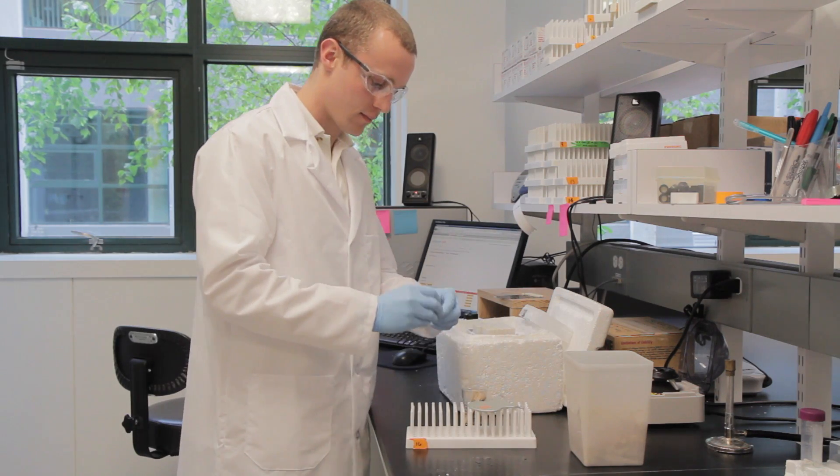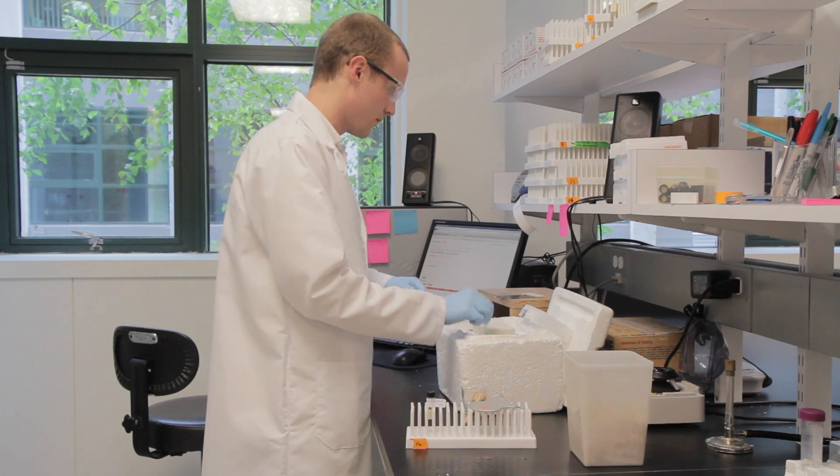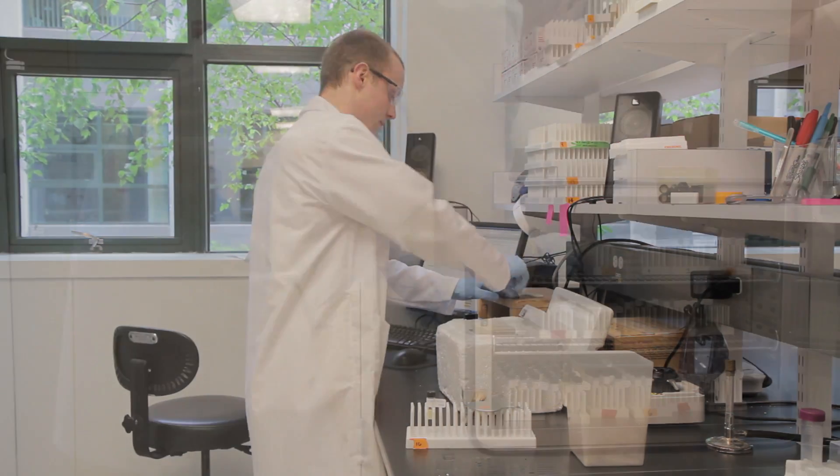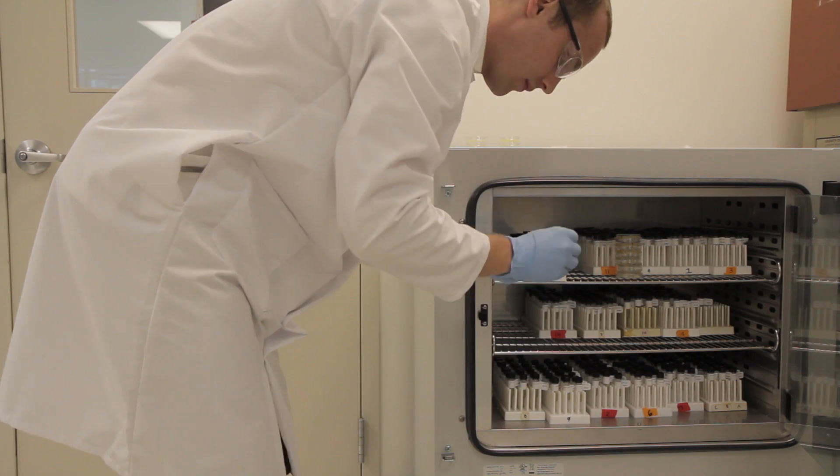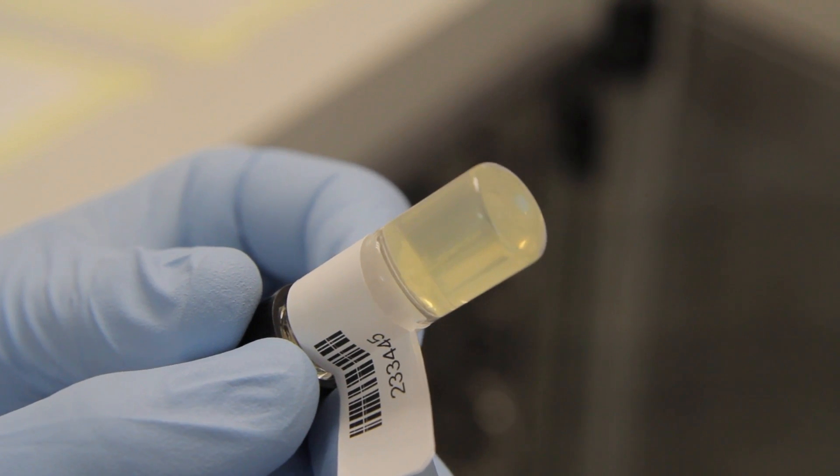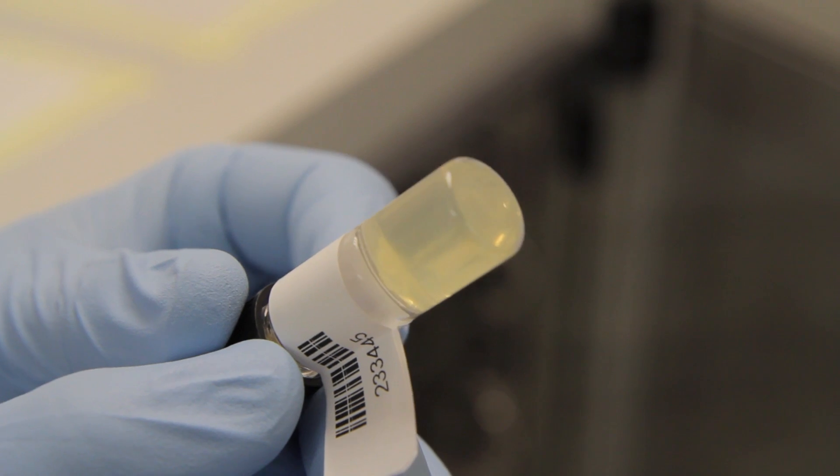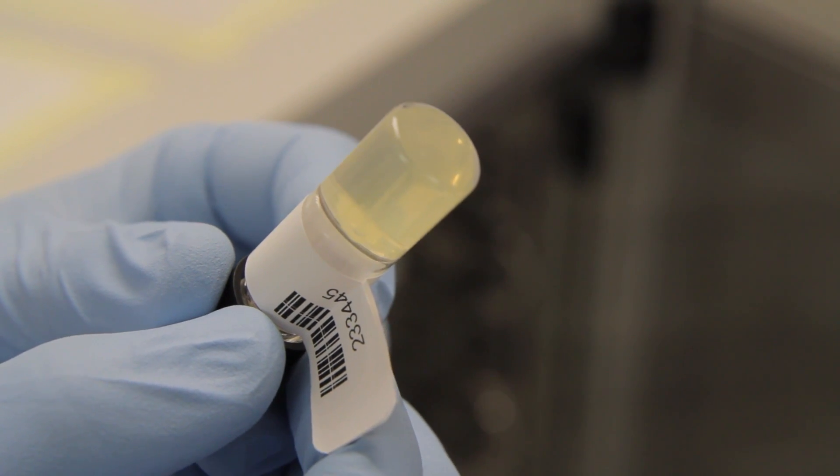Addgene technicians use a sterile toothpick to transfer a portion of the bacterial stock to the stab. The bacteria in the stab is incubated overnight and checked the following morning for growth. You should see bacteria on the surface of your stab.